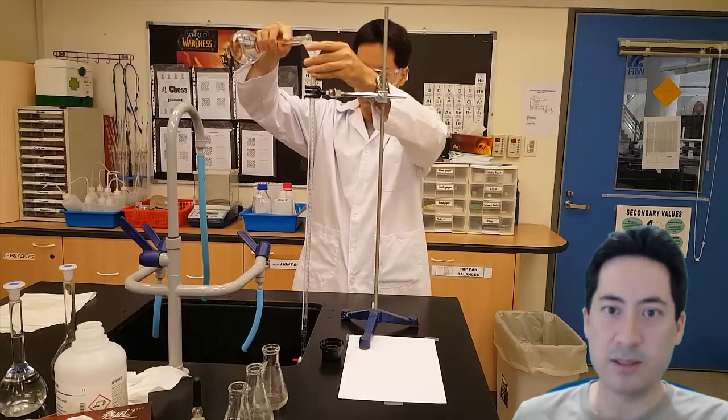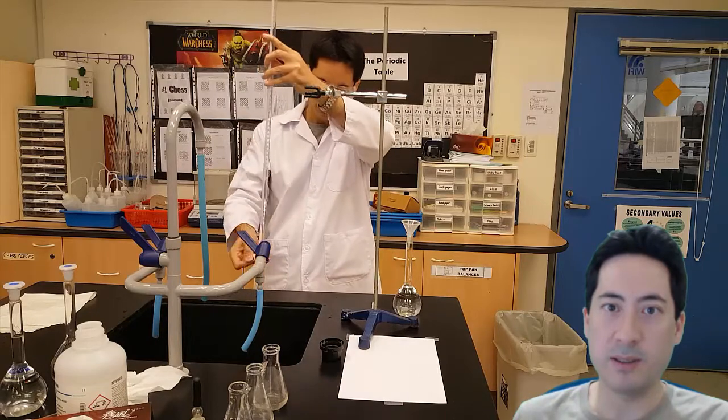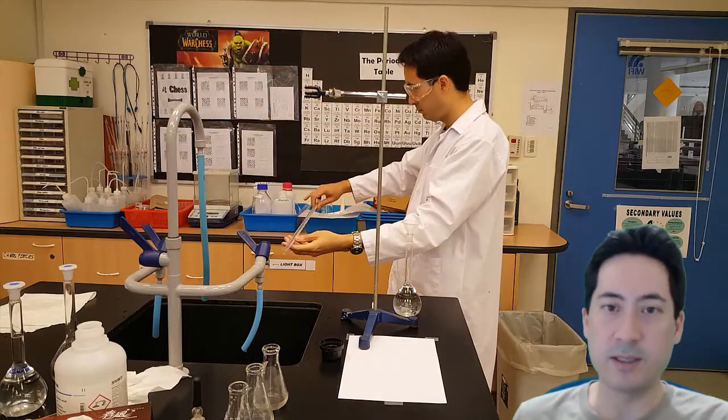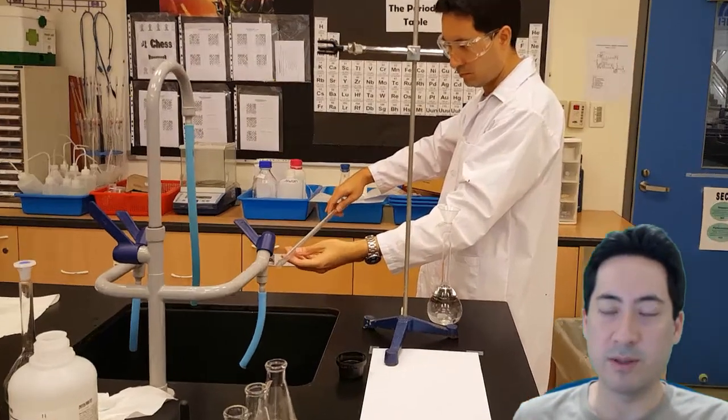So I've got my standard solution that I've made up. And I lower the burette to below eye height before I fill it. And first of all, again, I rinse out the burette with water and with the standard solution that we're going to use.